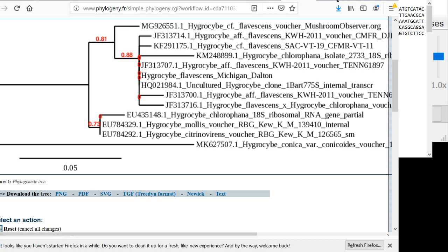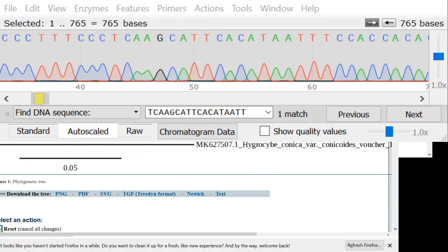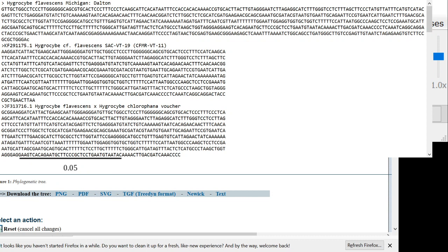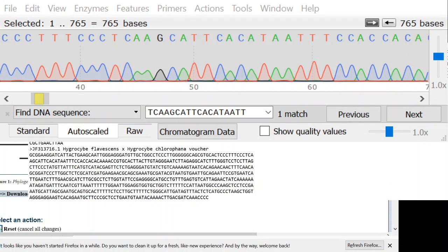I will show you now what it looks like when you have a sequence that's bad. Or not necessarily bad, but partially bad. Let's see. I think I have to add this over here to the stream. And we want this other one.